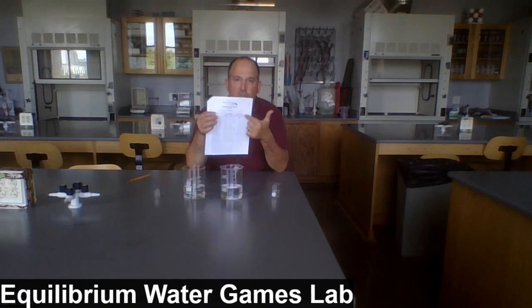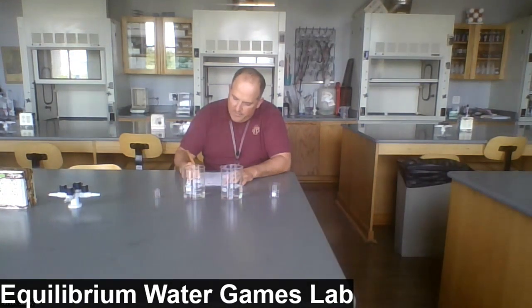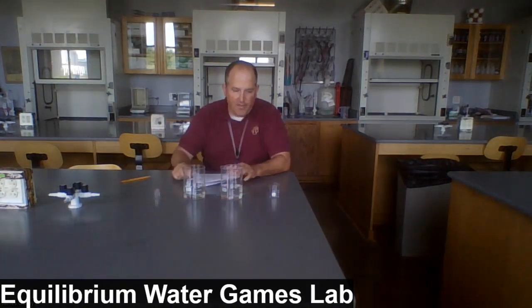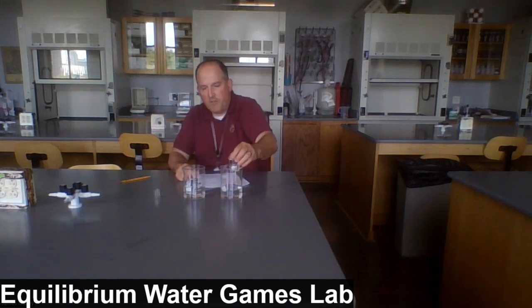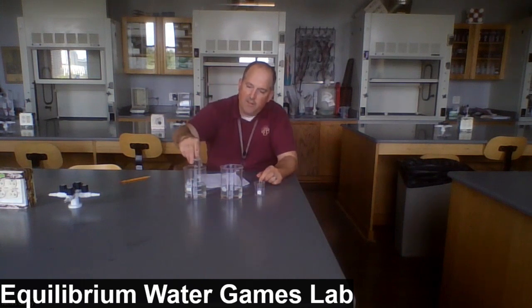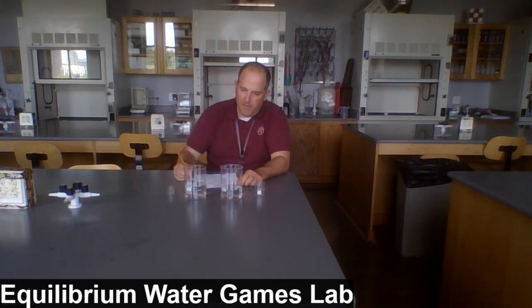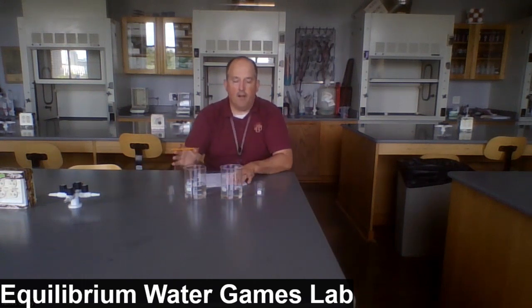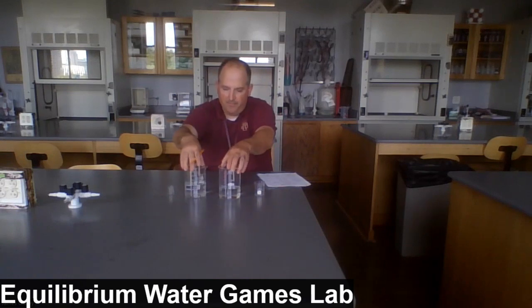So now we're going to fill out the data in part 2, so the right column. Initially, the volume in beaker A is 250 milliliters, and beaker B also 250. And let's do the same procedure. We're transferring as much water as we can from A to B with the 50 milliliter size beaker, and then from B to A with the 10 milliliter size beaker. And in each of those, moving from one side to the next and then back is a transfer cycle.